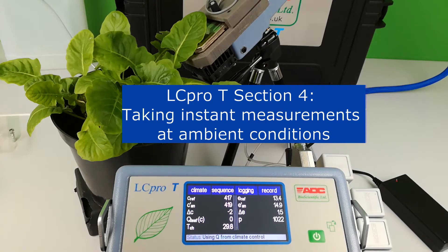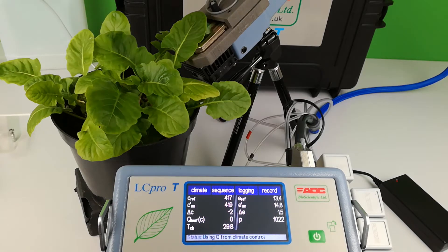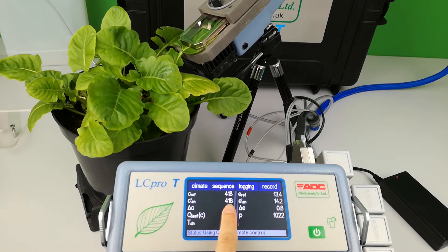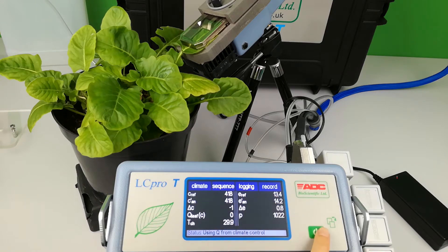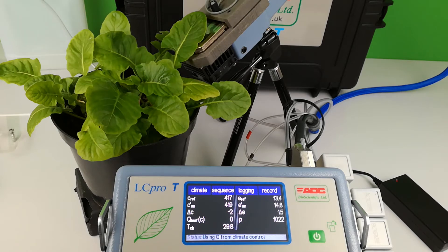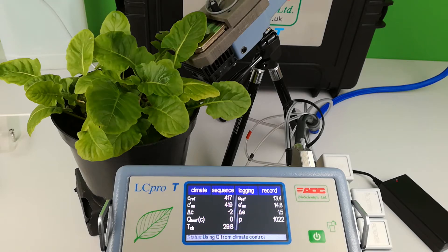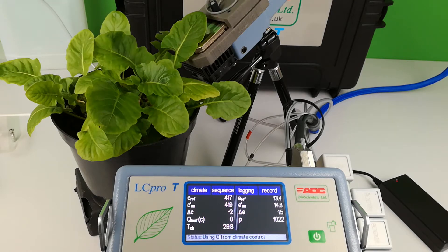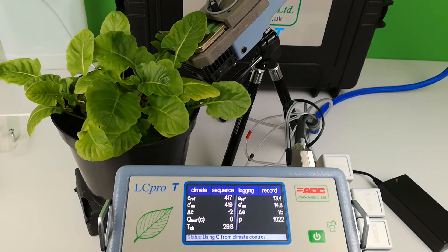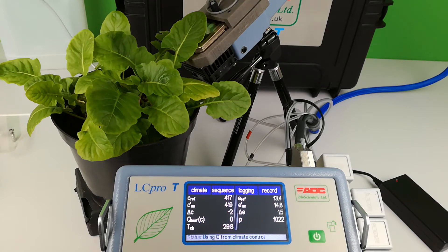Section 4: Taking instant measurements at ambient conditions. With the chamber closed and empty, view the CO2 ref and CO2 analysis readings on main menu 1. These should stabilise in seconds to give similar CO2 concentrations. If these do not stabilise, check the chamber gaskets are sealed properly all the way around the chamber window. The H2O concentrations should also be checked for similarity.